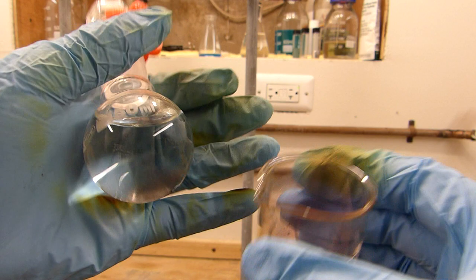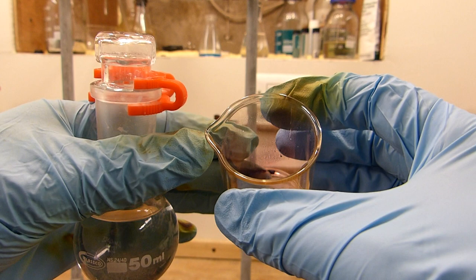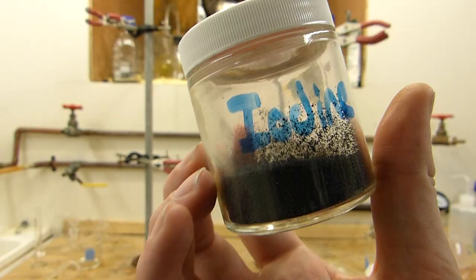It forms nice beautiful crystals. And you can do this on a much larger scale. And that's how you would purify it prior to an experiment if your experiment required the purification.